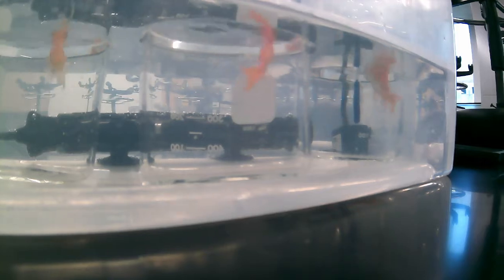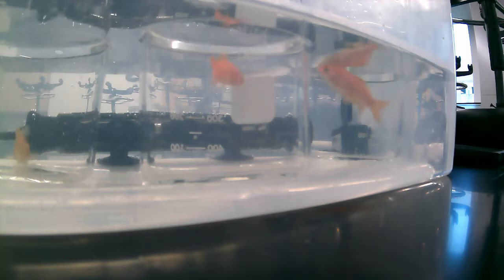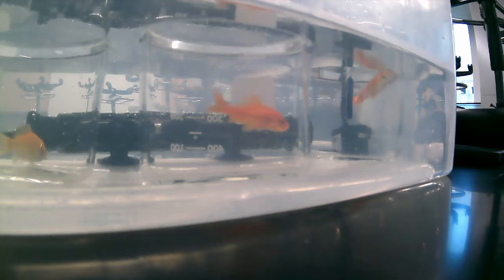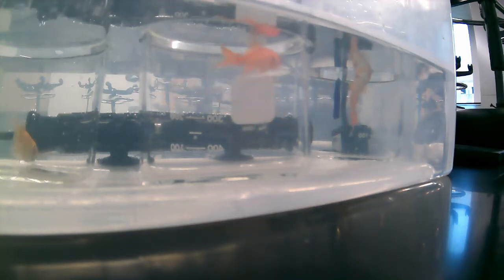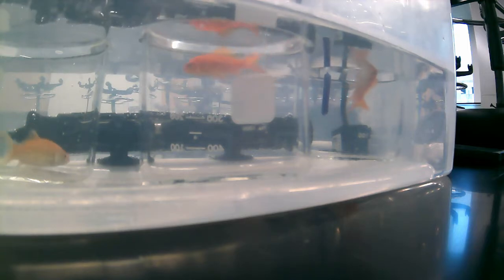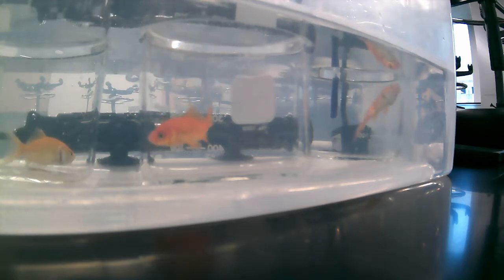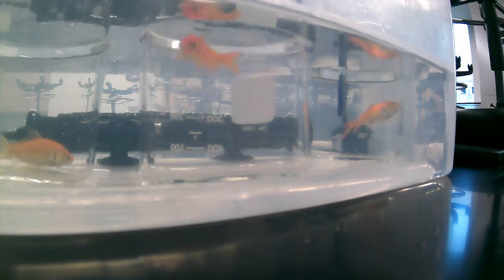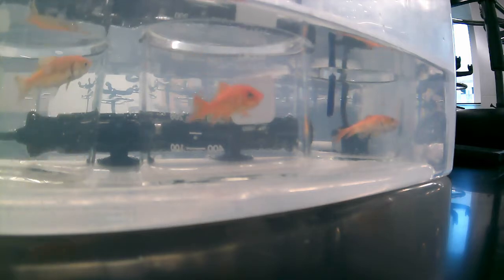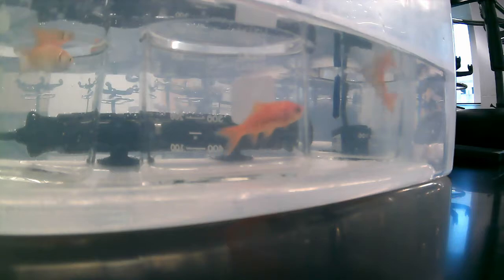Your job then will be to calculate the overall rate of temperature change, and then to get an average number for the critical thermal maximum temperature for goldfish. We'll have a second run that we will provide data for, for goldfish that have been acclimated overnight to a higher temperature, and we should see some changes in those.